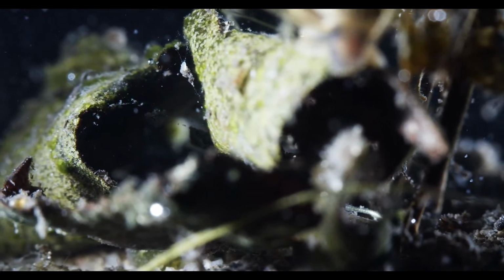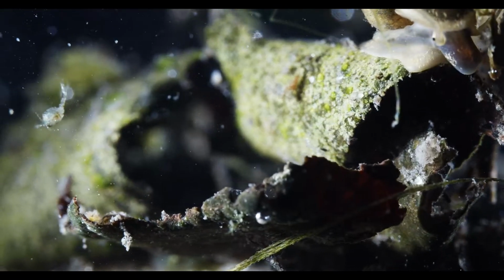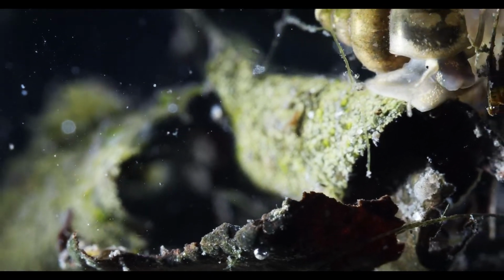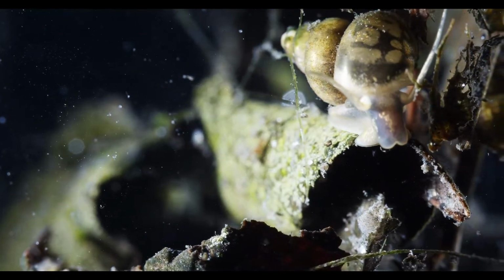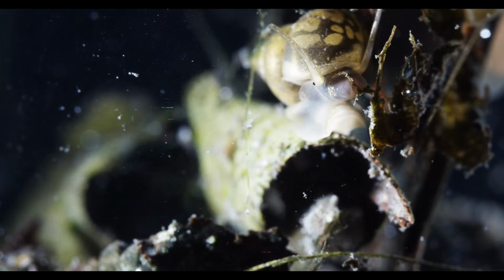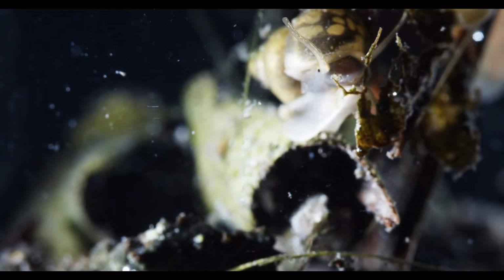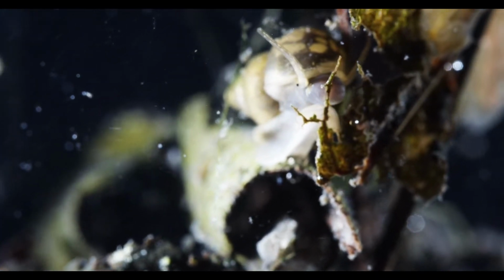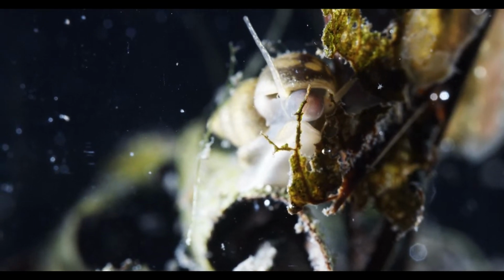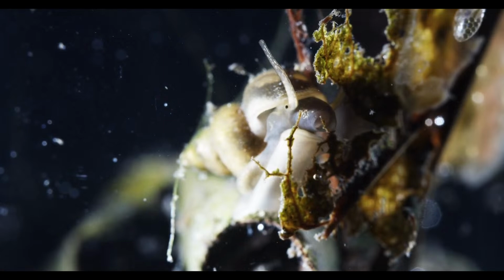Yeah, we'll see. I mean, kind of like this, exploring with people and watching these guys here. Look at this snail. It's just fun to watch, isn't it? Let's see the radula sticking out or pushing out, and it eats the biofilm of this skeletonized leaf.